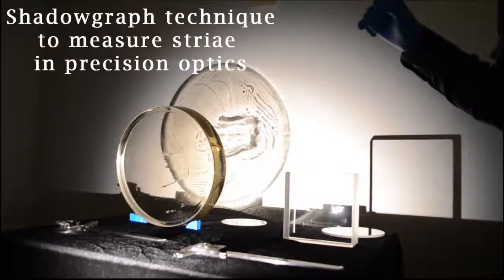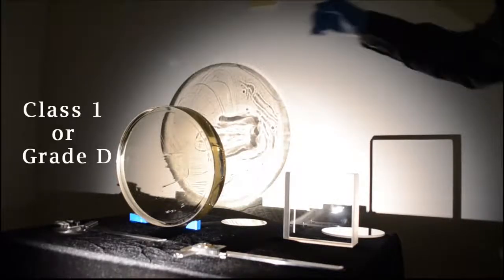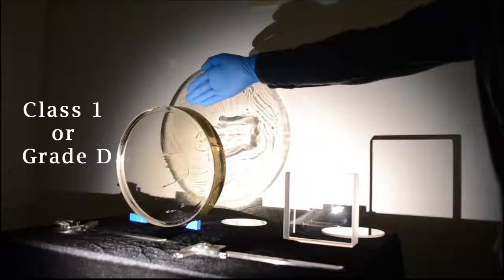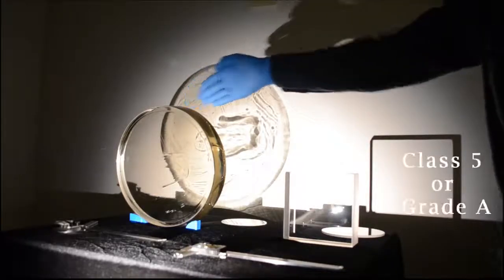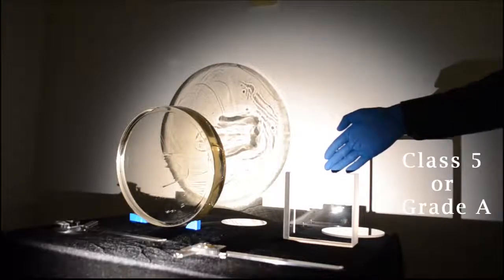We're demonstrating the shadowgraph technique used to measure striae within the bulk of precision optics. On the left, we have a Class 1 Grade D optical window, and on the right, we have a Class 5 Grade A optical window.